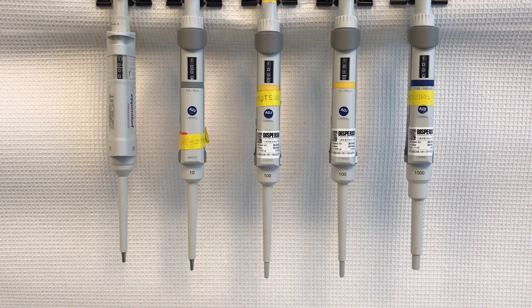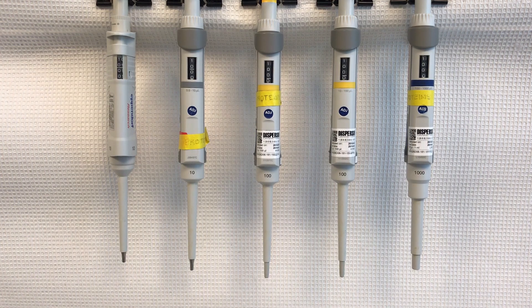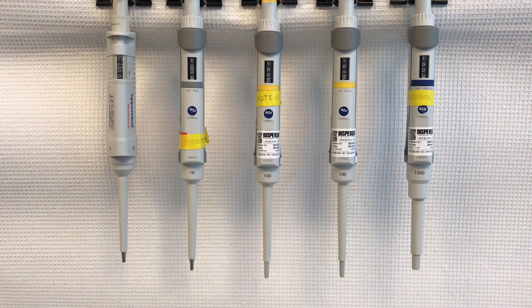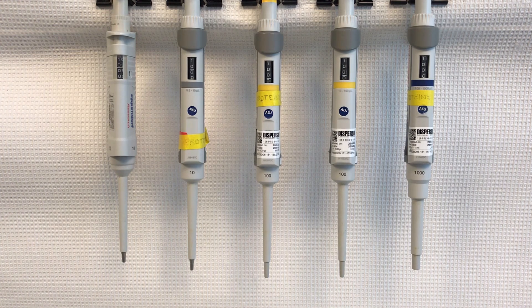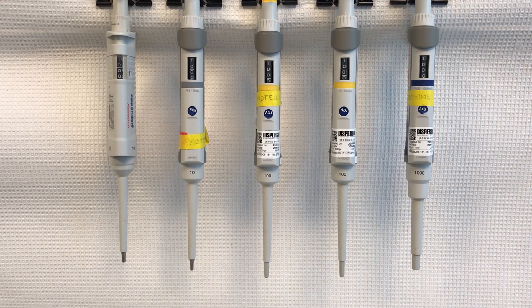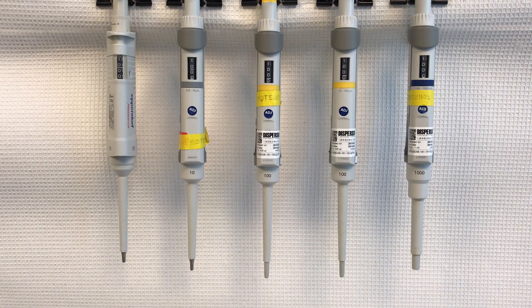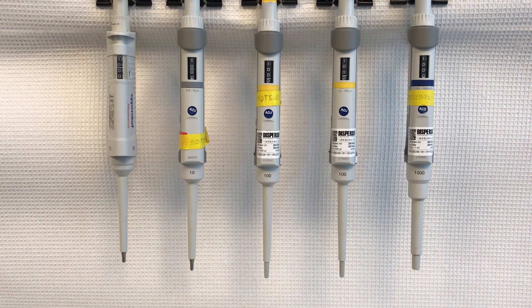A pipette is an important tool used in many fields of science. It is a laboratory tool commonly used to transport a measured volume of liquid.